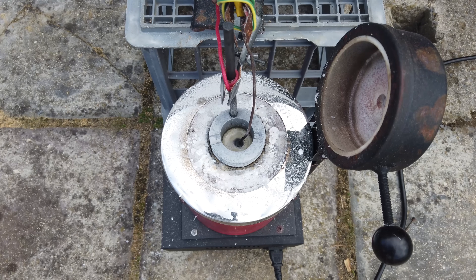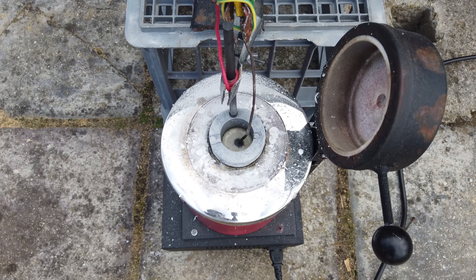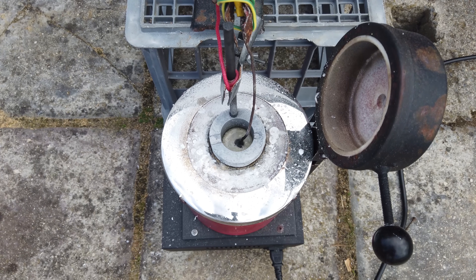I've only done about five minutes of electrolysis here, and I'm starting to see — and I'm pretty sure you can too — quite a big kind of black chunk on the end of the cathode there. It looks like that's magnesium. I didn't really expect it to be this easy to make it, but I think that might be it. I'm going to leave the electrolysis running for as long as I can without any problems and we'll see if we can extract that blob.